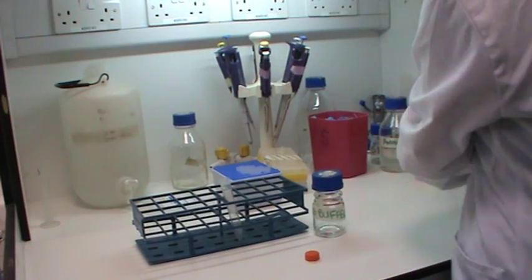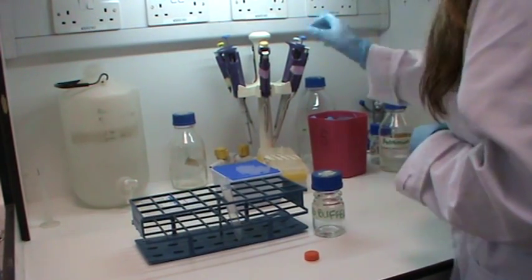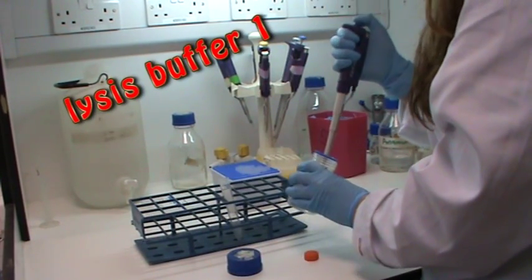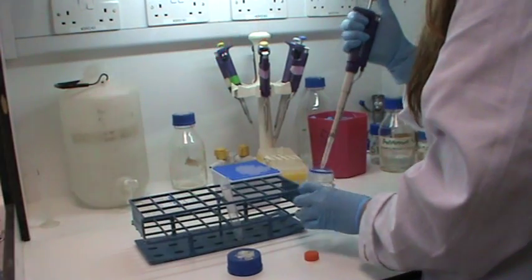Next I need to break down the cell membrane. I am doing this by using a pipette to mix it with lysis buffer. In the lab we call this mixing resuspending.